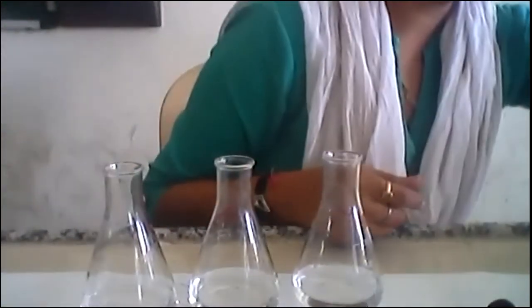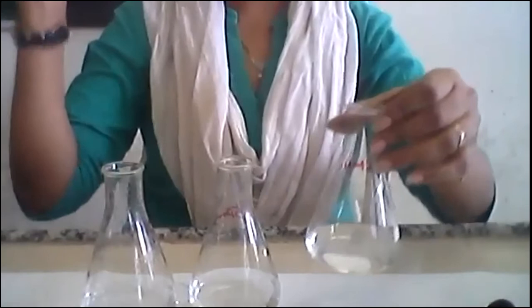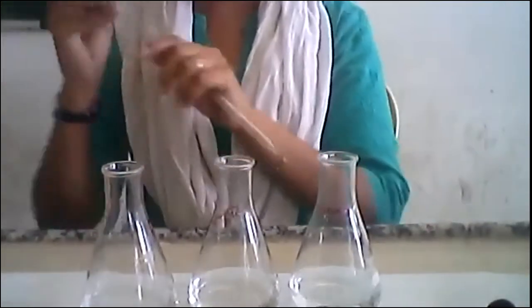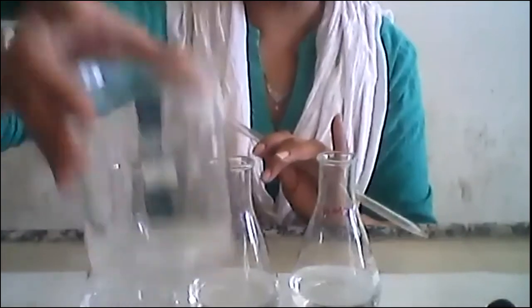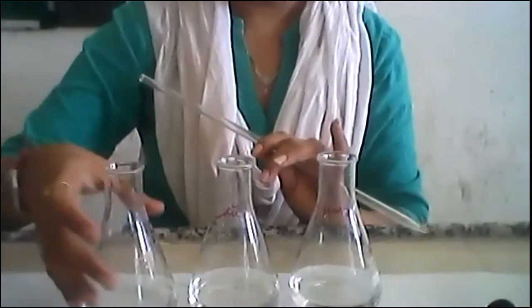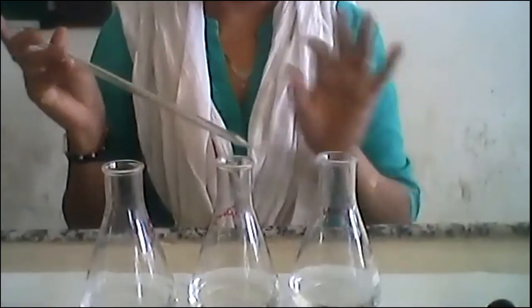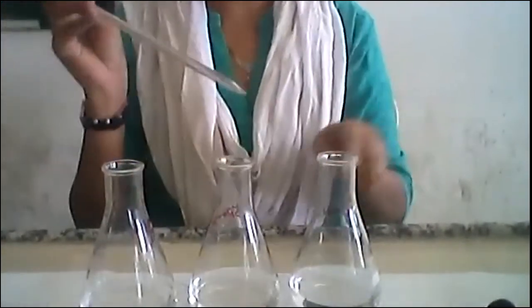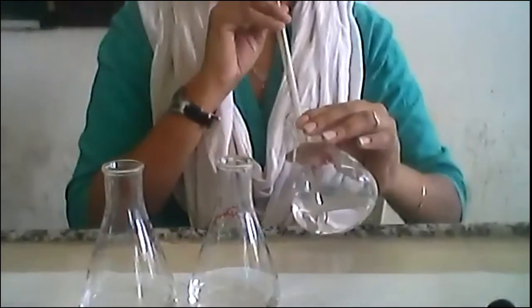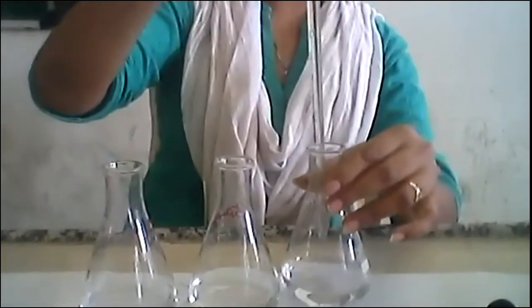I am going to collect 5 ml using a 5 ml pipette for the zero-minute reading. Since all three flasks contain the same sample at this point, we are not going to take a zero-minute reading from each and every one — I am just going to take it once for zero minutes.